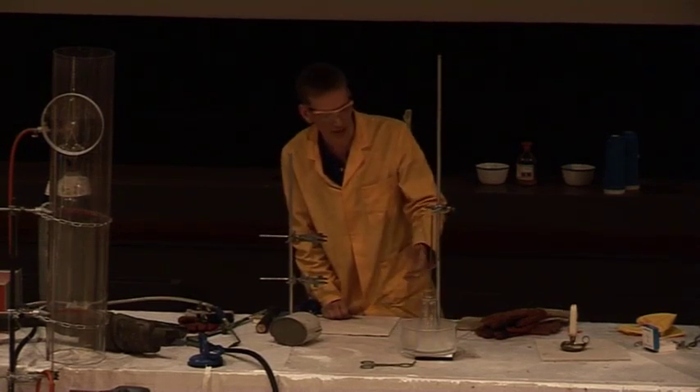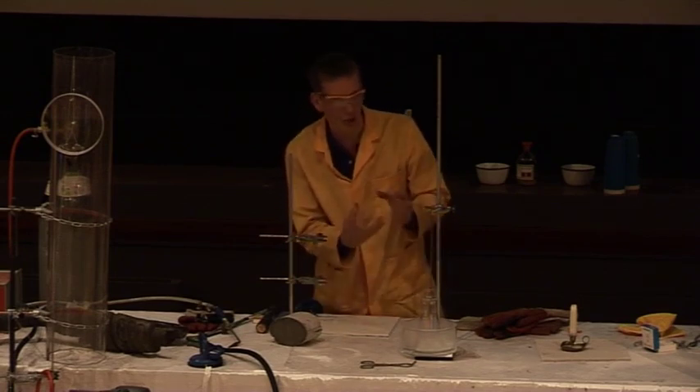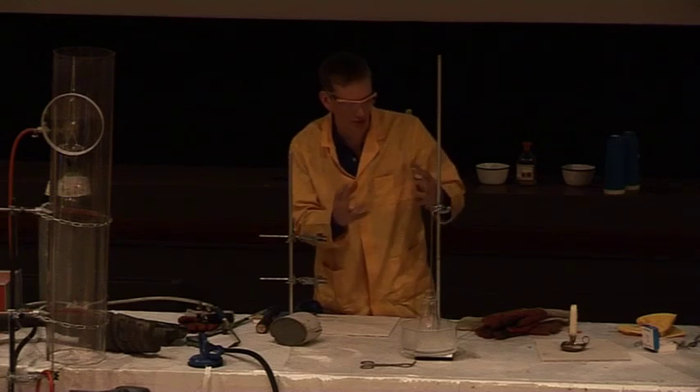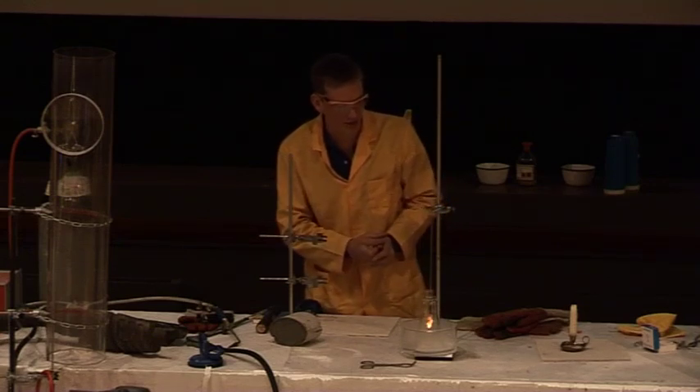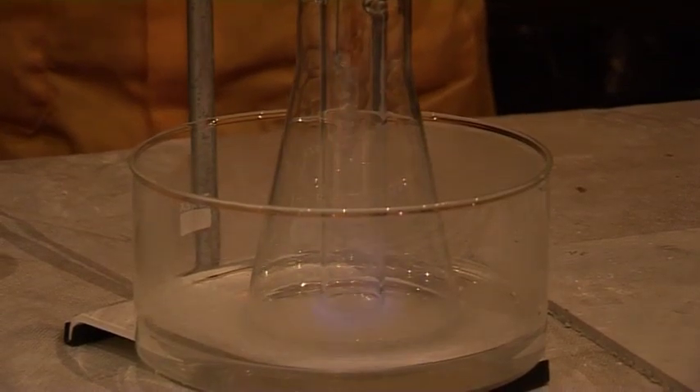The whole process should start again. The methanol vapor is rising over the catalyst and it will glow red hot as the methanol and oxygen come into contact with each other on the surface of the catalyst — glowing red hot. And again it should light the methanol itself, then it blows itself out.